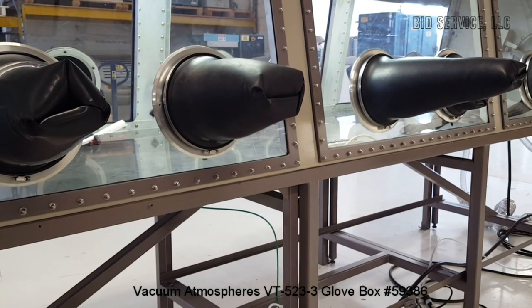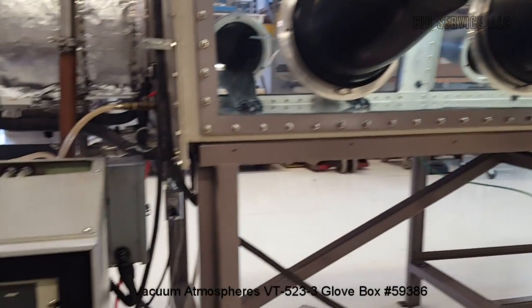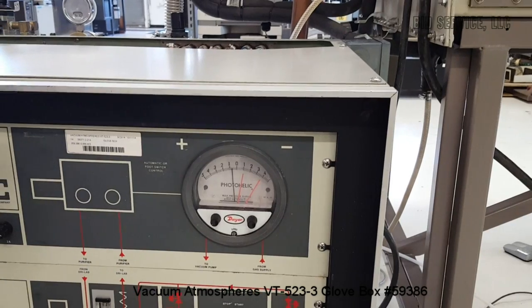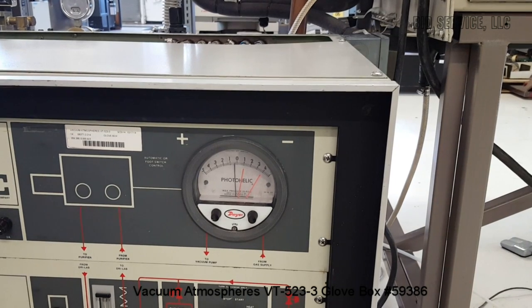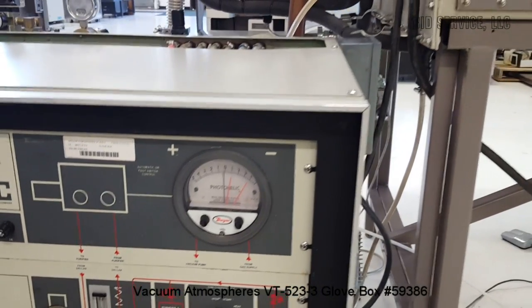If you bring it to slightly negative, you can hear the vacuum pump pulling the inert gas out of the glove box through the exhaust to maintain that pressure. Your upper and lower range limits are set here. This will take a little while since the glove box is so large, but you can see the gloves are now being pulled in.